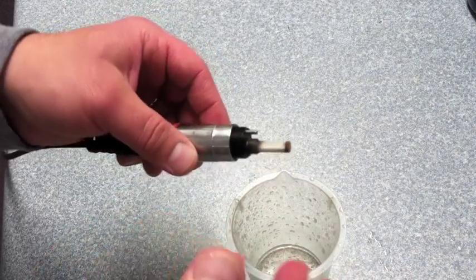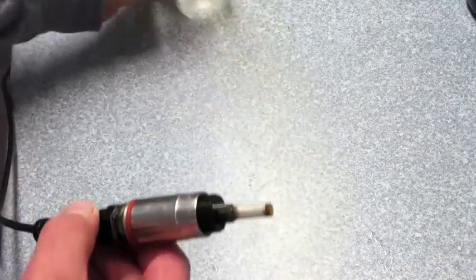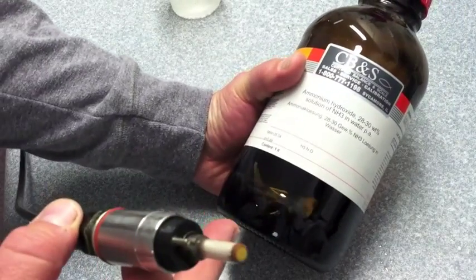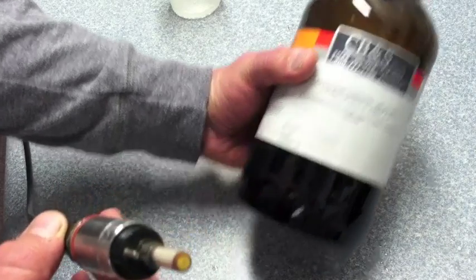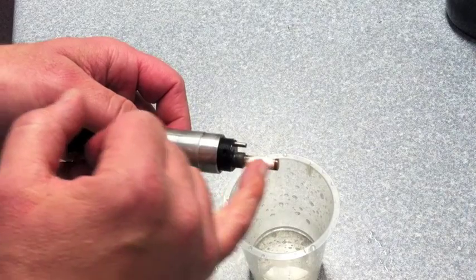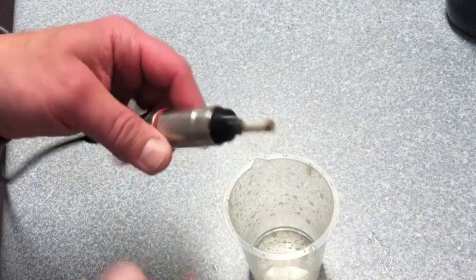After you do mechanical cleaning, and if you feel that it's still not performing right, the last thing you can try would be some ammonium hydroxide. You can use a 14%, but only for about 2 to 3 minutes. And if you dilute it down to 3%, you can do that overnight. That would be a chemical cleaning on the silver anode part of your probe.